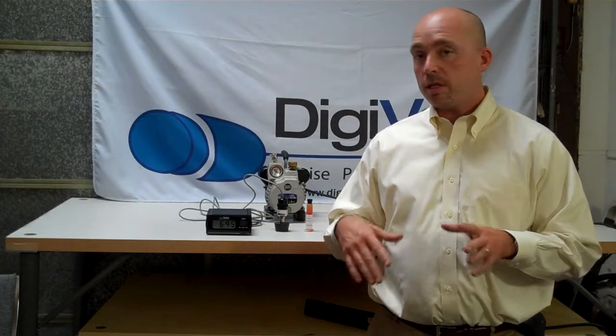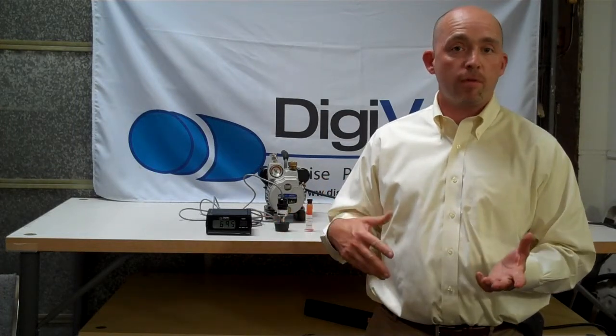What we're going to do is we're actually going to test a vacuum pump to see if it's performing well or if it's not performing well.